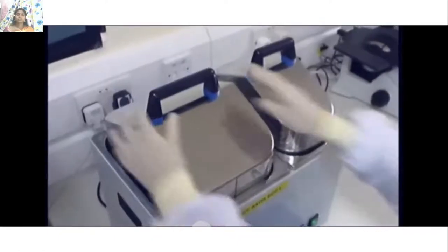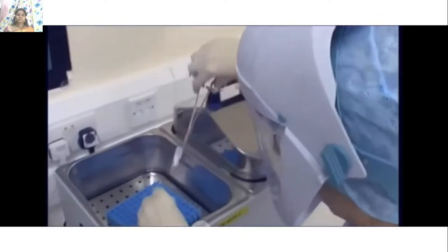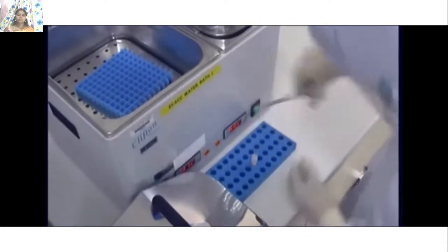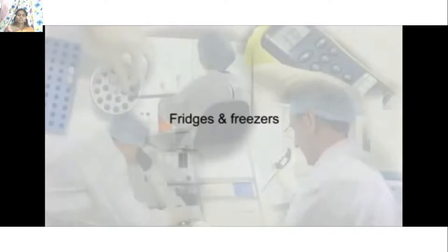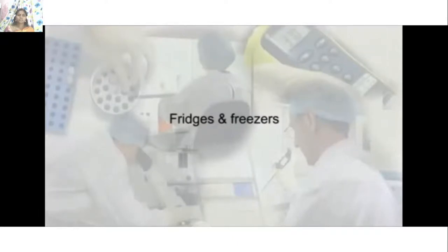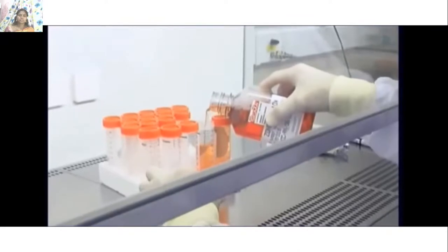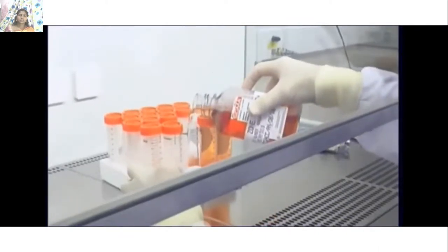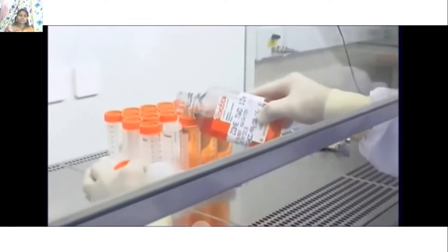Water baths are used for thawing frozen cells, heat inactivation of serum, and warming media and reagents prior to use. As a potential source of contamination from bacteria and molds, water baths should be regularly cleaned and replenished with fresh water treated with a suitable antimicrobial agent. Most cell culture reagents require storage in a fridge or freezer — always check labels and supplier literature. Aliquot reagents into suitable volumes and concentrations to avoid repeated heating and cooling, and always label containers appropriately.